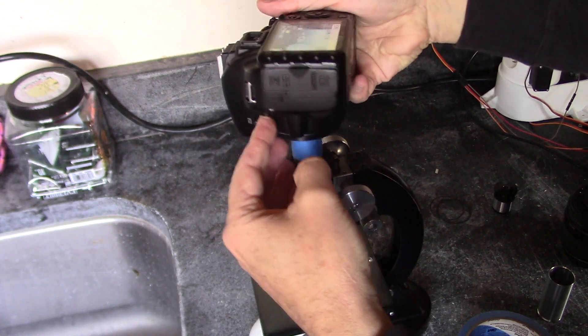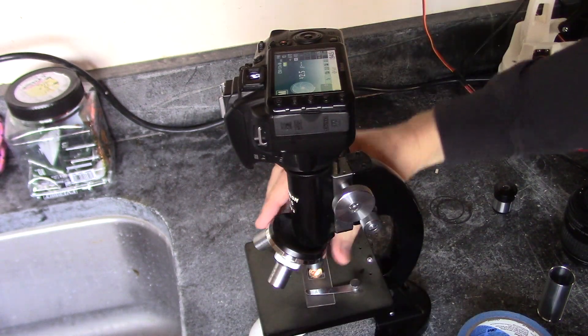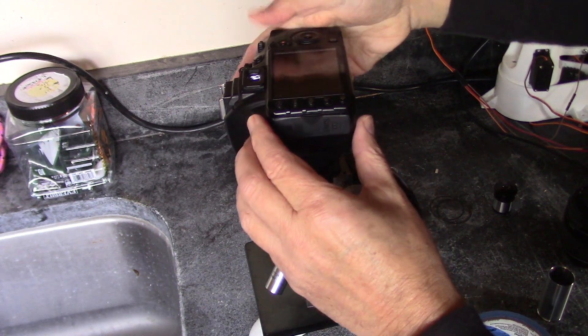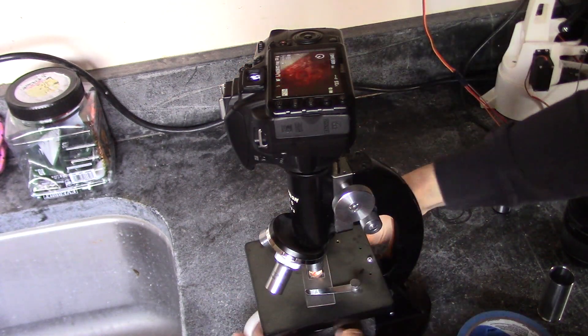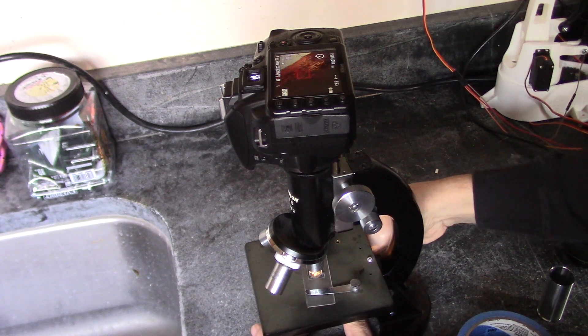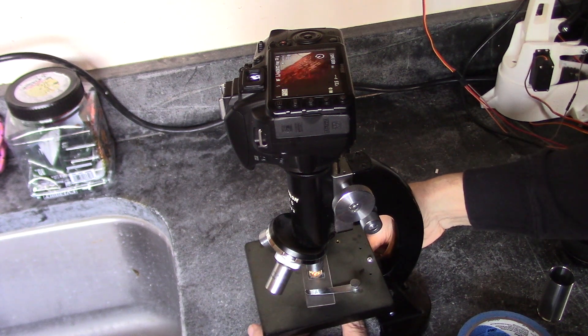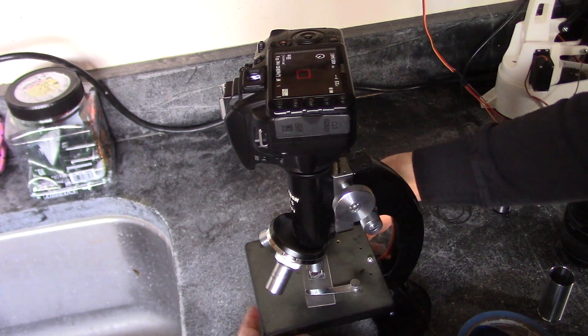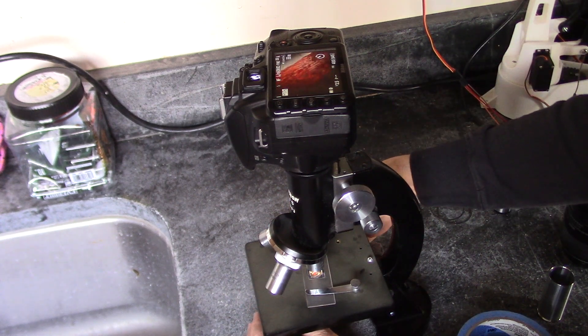Now let's try a little bit higher magnification. Let's try medium, and back into live view, and then I've got to adjust that. Well, as we get higher magnification, I have to make sure the light is just as bright as possible. Well, I'll have to fiddle around with this, it's too bad I don't have this part.